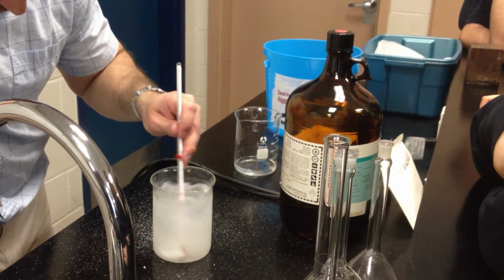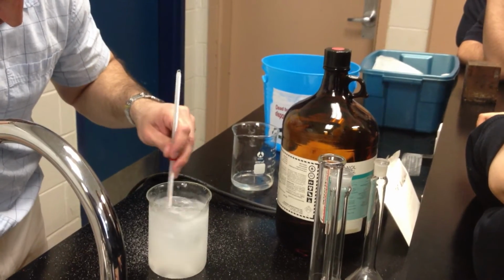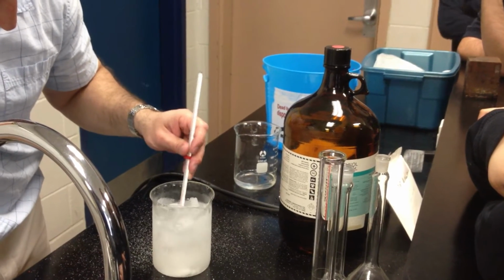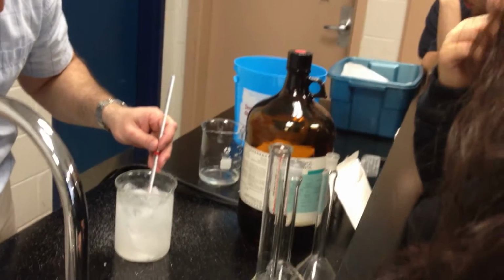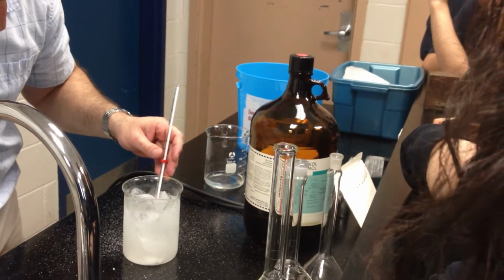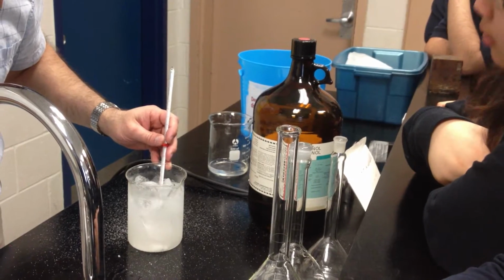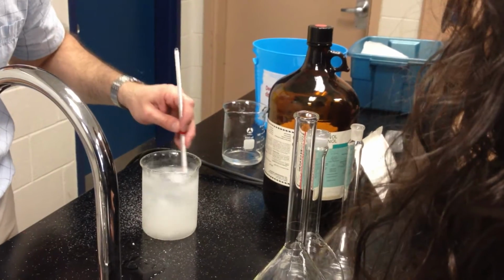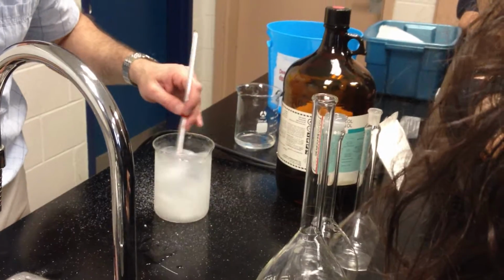If you were to chill water below the freezing point, you might be able to supercool it if the water was pure, but it would then suddenly form a crystal, as you sometimes see on the windshield of your car on a cold morning. You'll see ice crystals forming and racing across the windshield when you put water on it, or if you don't have good windshield washer fluid, or if it's a particularly cold day. We see the temperature is already down to 4 degrees below zero, and if you keep on stirring, the temperature will eventually drop to about minus 11 Celsius.